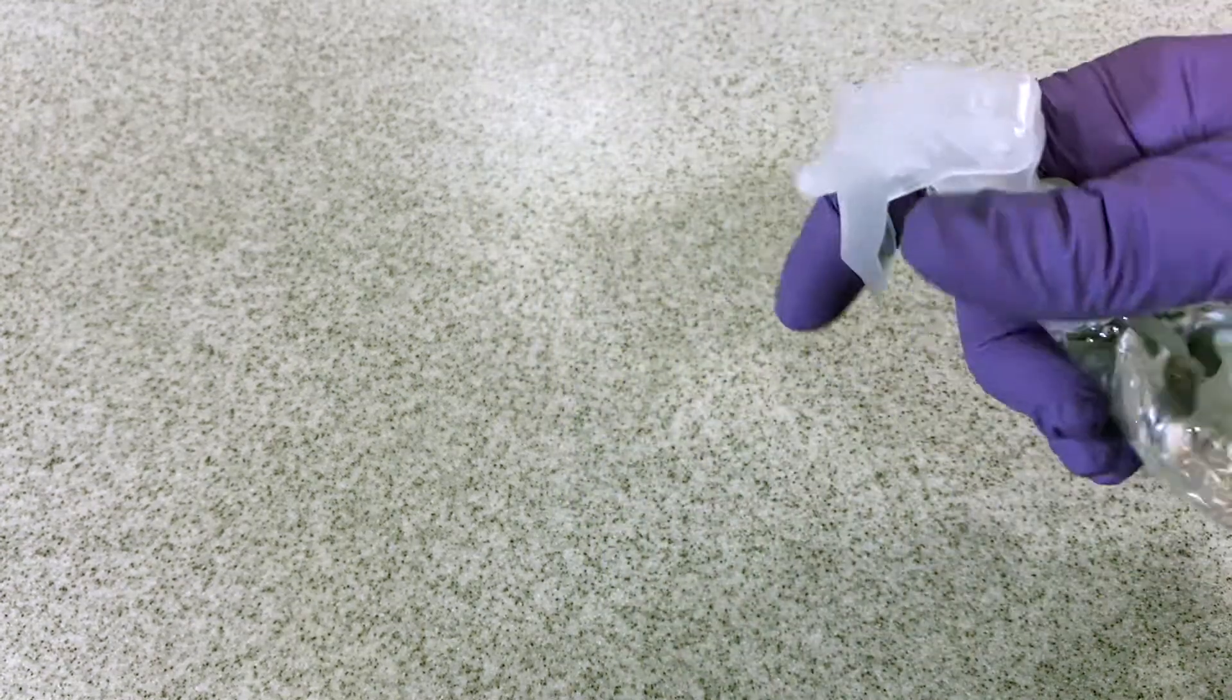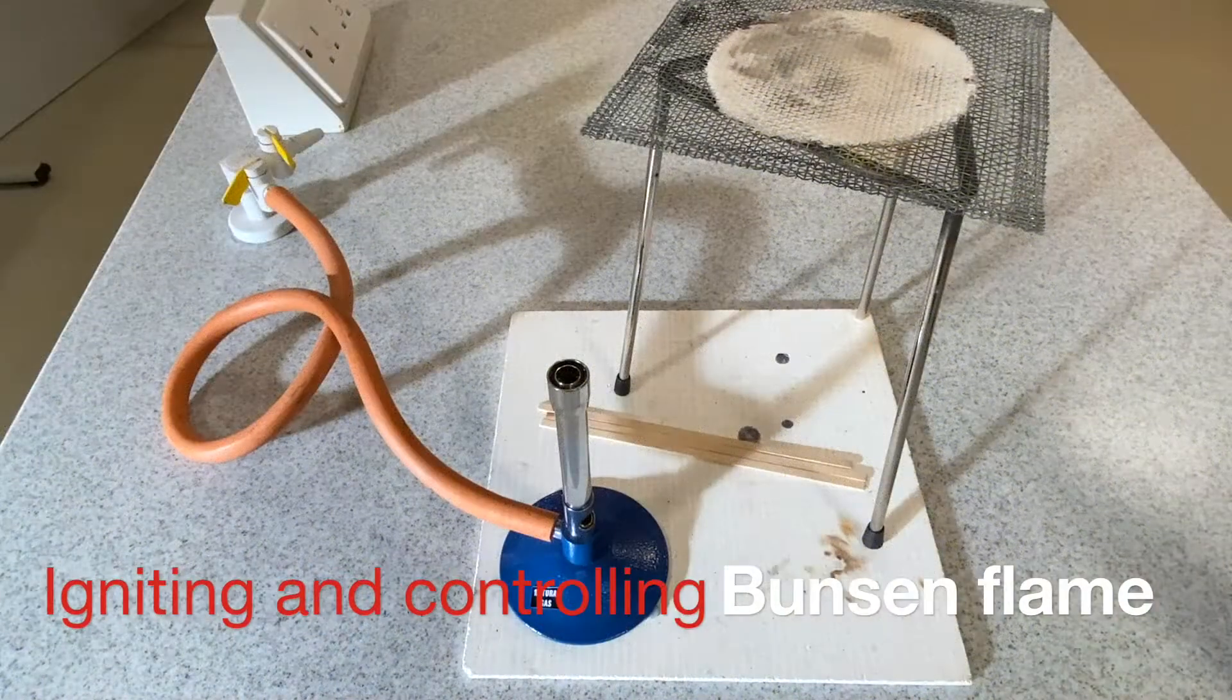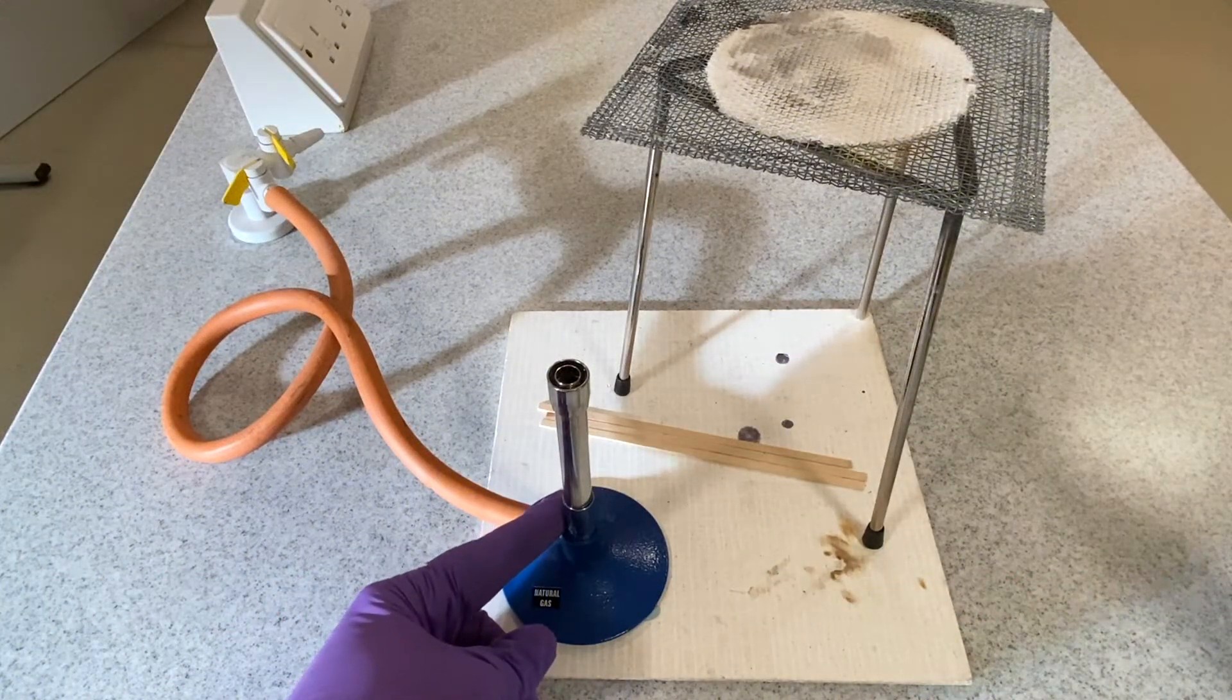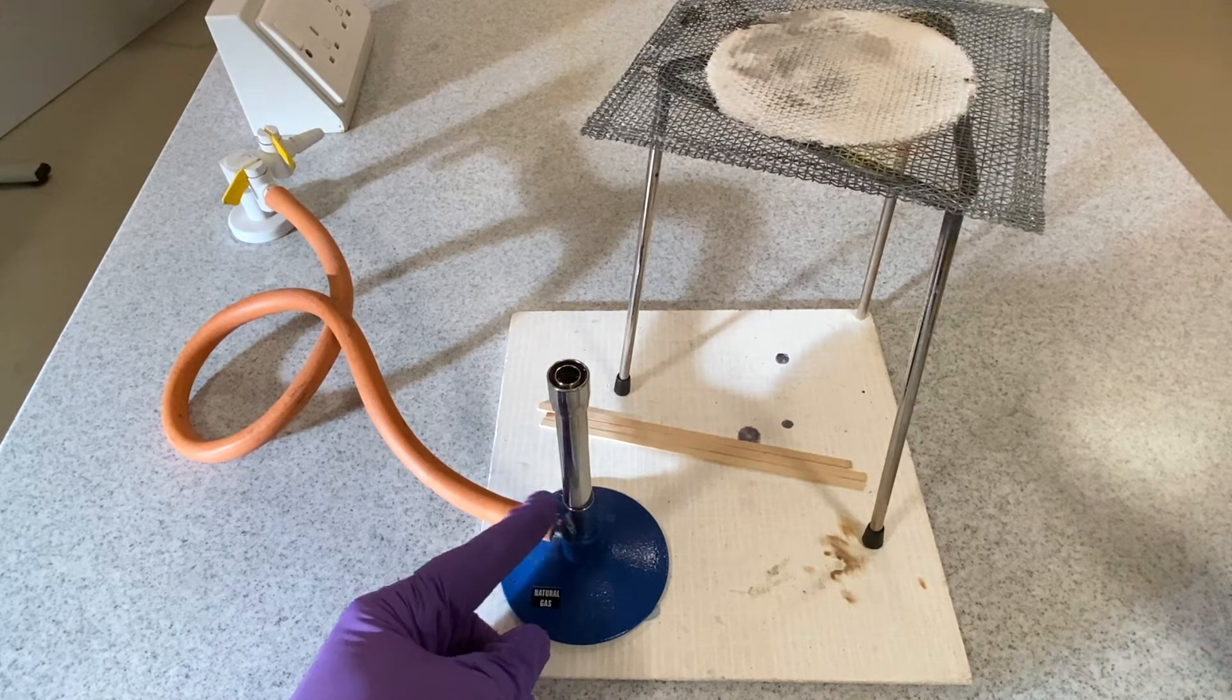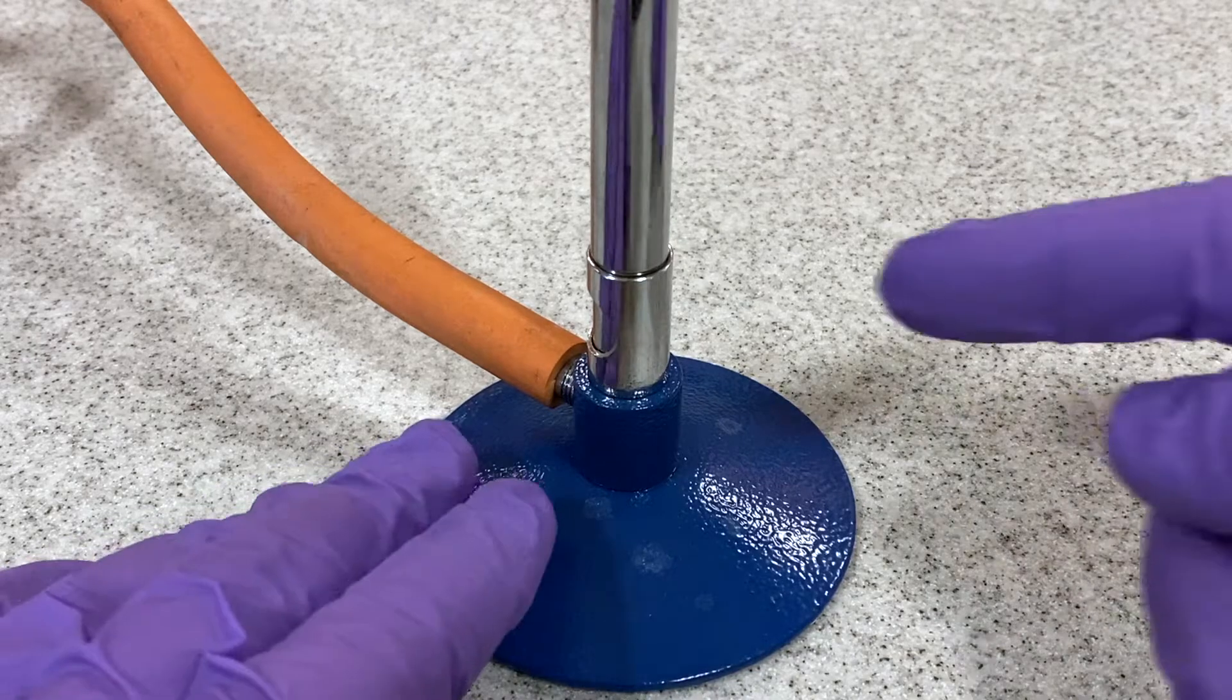In accordance with the direction from your tutor, benches must be sterilized before this activity is carried out to prevent cross-contamination. One of the most basic laboratory techniques is the safe ignition and control of a Bunsen burner flame.